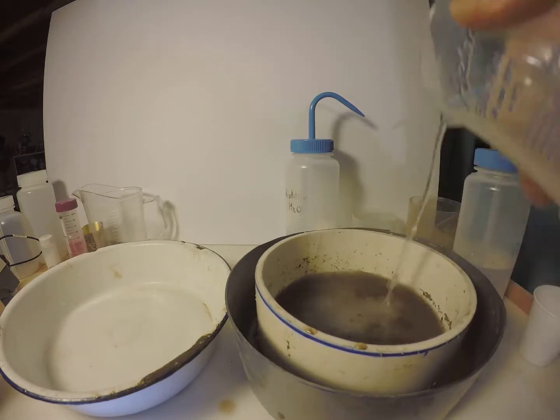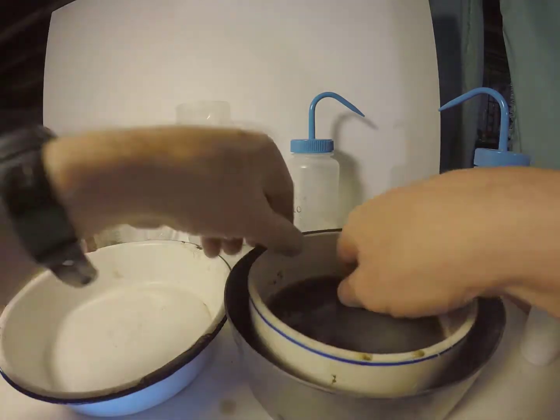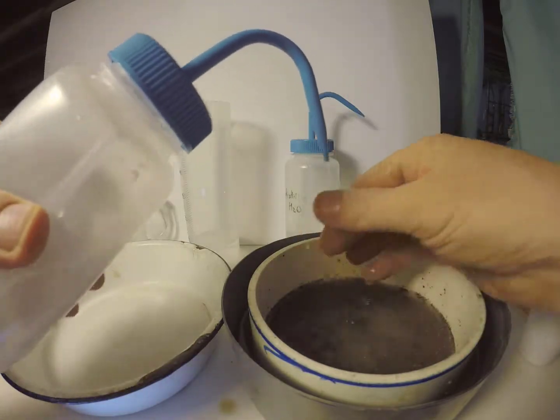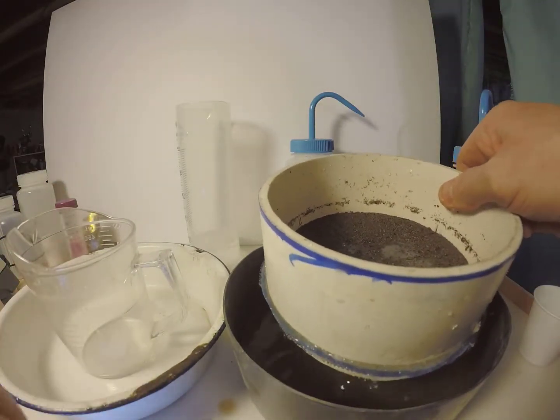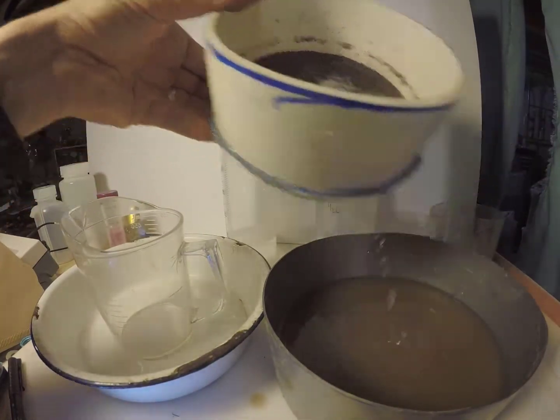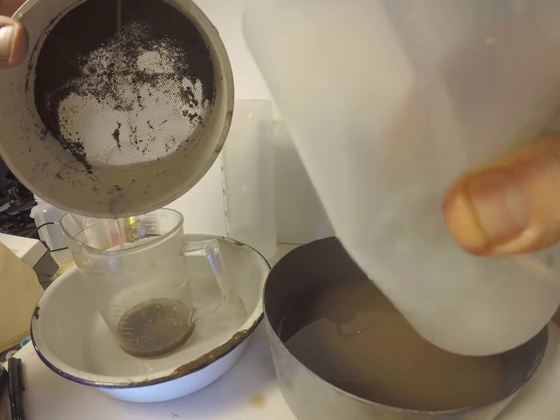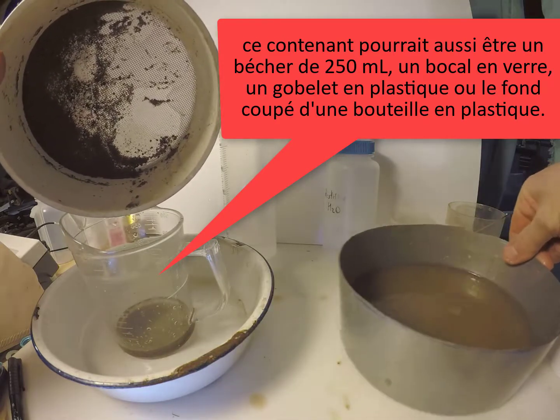The water in the bottom basin can be changed during this step as well. This fraction is then also briefly rinsed. Now the 250 micron fraction is transferred to a small cup or beaker. A measuring cup, a cut plastic bottle, or a plastic drinking cup can work well also.